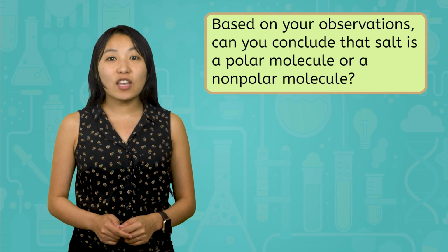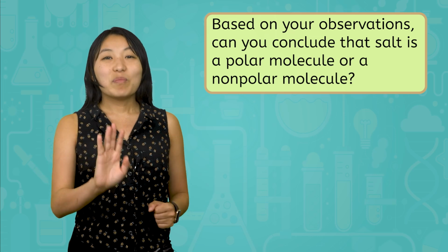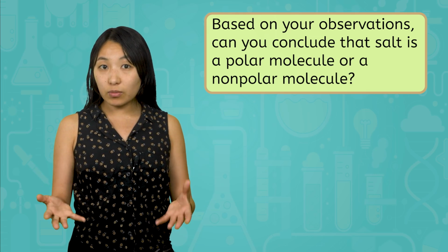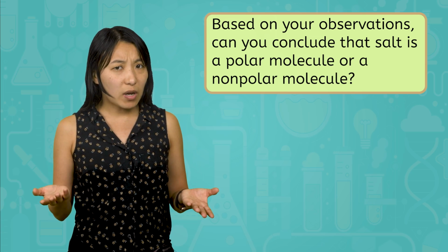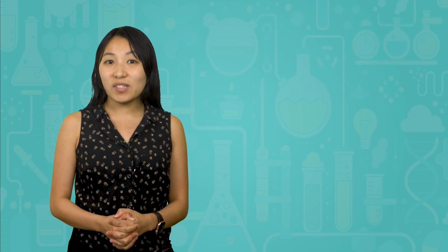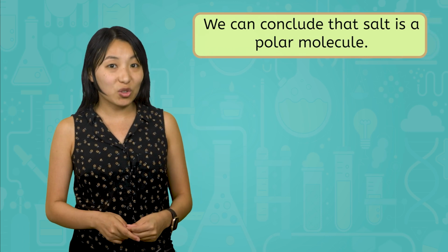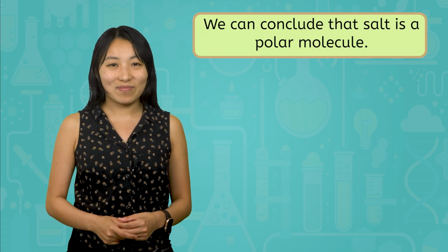Based on your observations, can you conclude that salt is a polar molecule or a non-polar molecule? Pause the video again and record your thoughts in your interactive lab notes. If you're having trouble, look back at your notes from the beginning of the video and ask yourself, what type of molecule is water good at dissolving? Water is good at dissolving polar molecules, and since salt is soluble in water, we can conclude that salt is a polar molecule. If you need to modify your conclusion, feel free to pause the video and make adjustments.